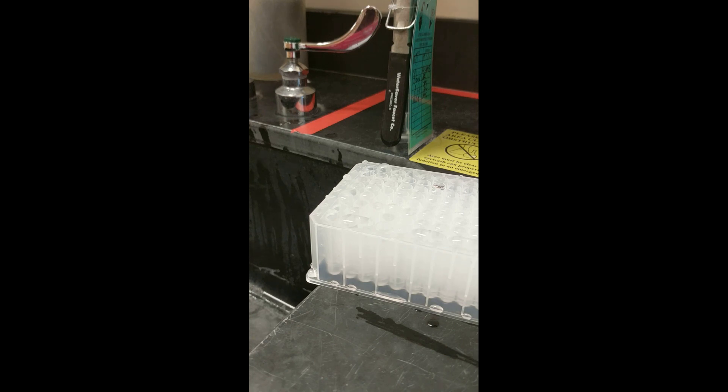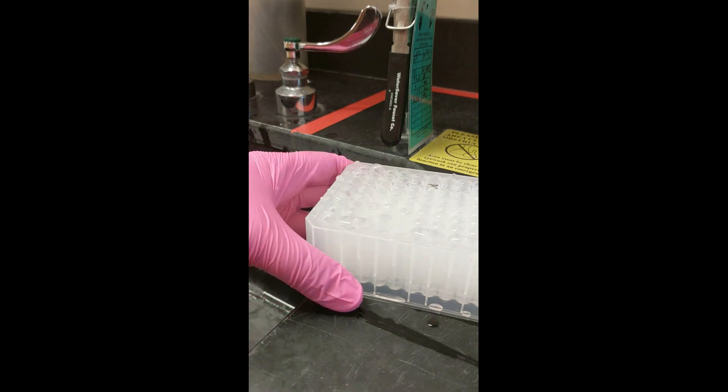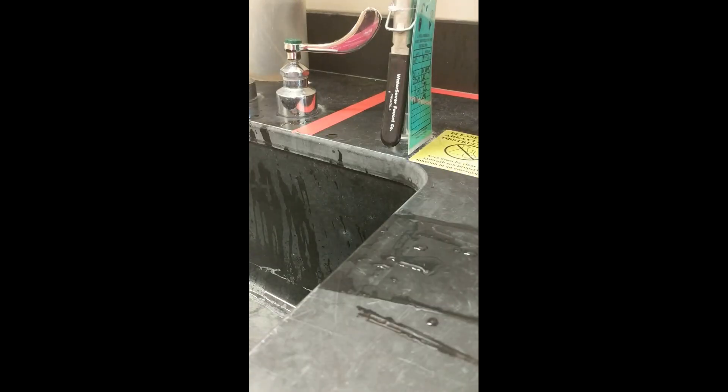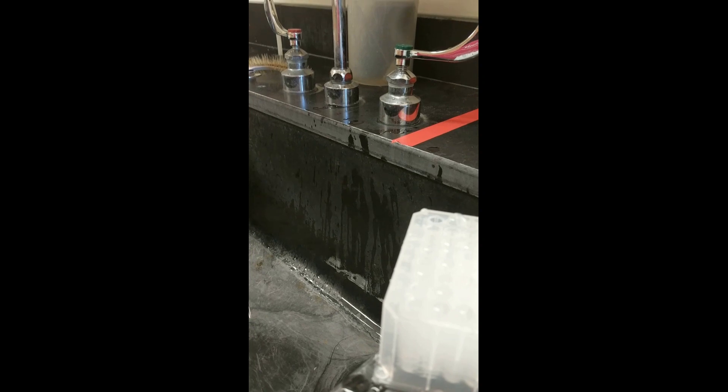Following that, you should decant the ethanol in the same manner as you did before. You should then let the plate air dry on the tabletop for 1-2 hours and then you have your pelleted DNA.